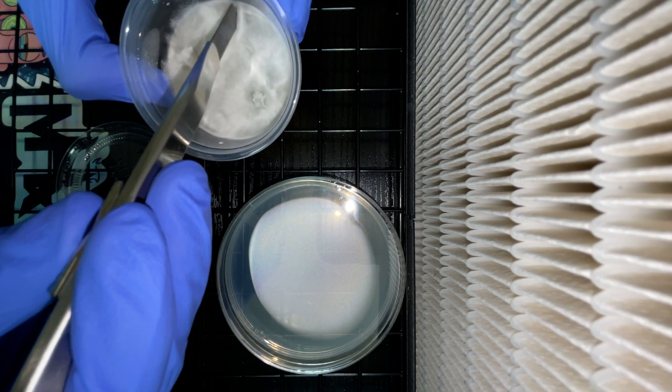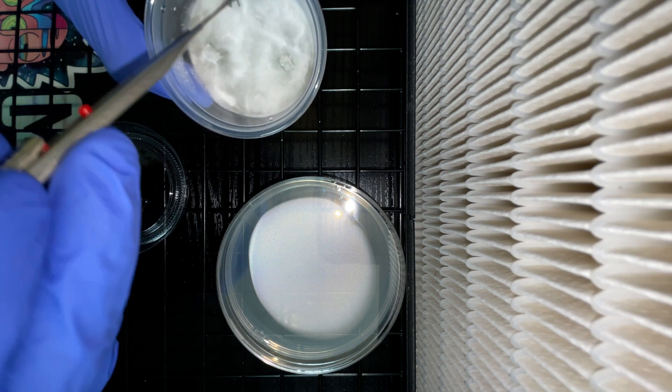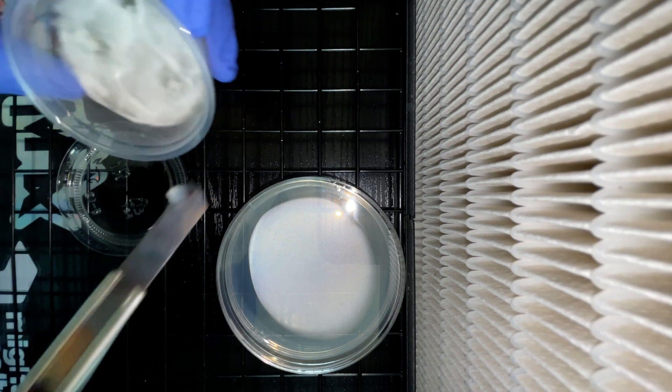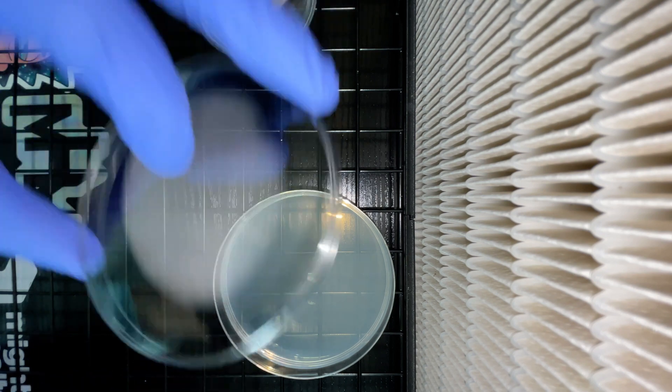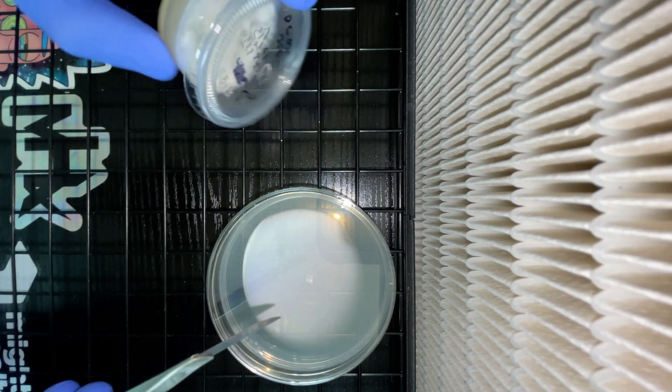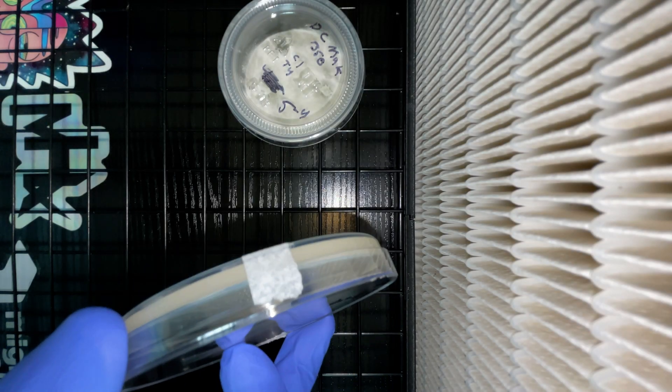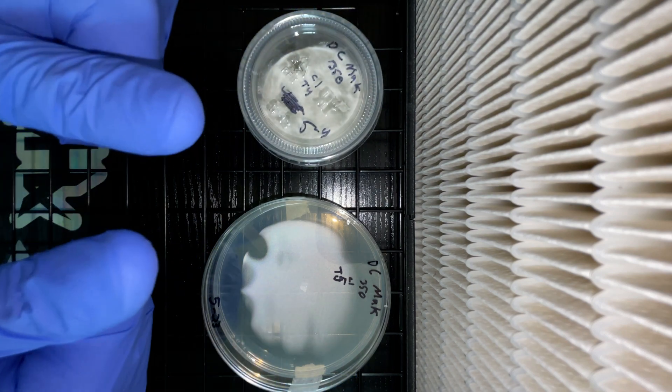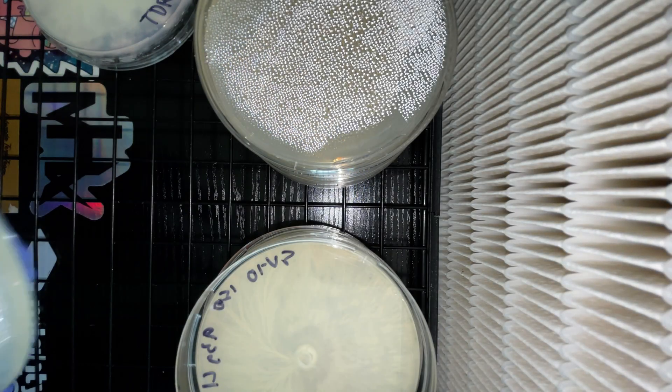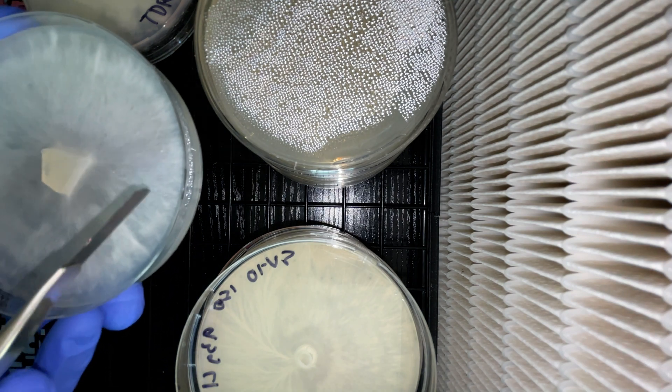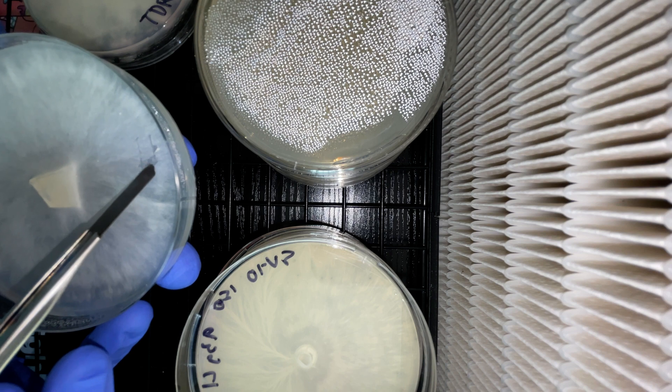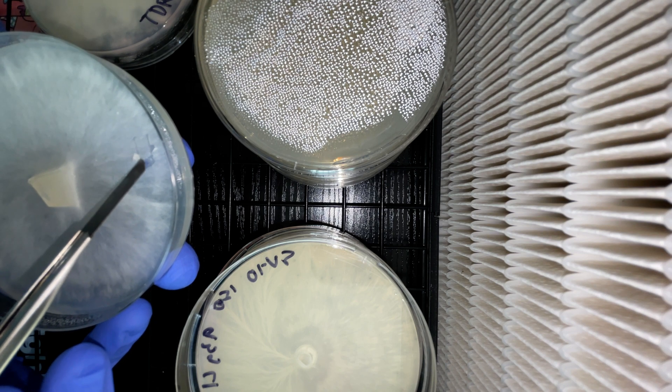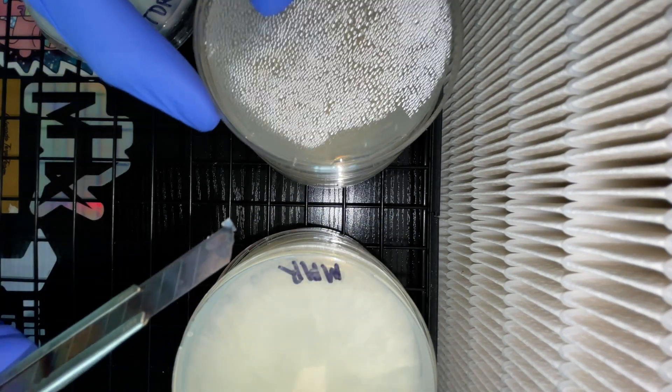This is one of those set projects that I was talking about. I actually only had one of them contaminate on me, but within one transfer I was able to clear it up and it's looking perfect now. I believe I received 16 cultures and all of them are looking perfect. These are actually some of the original plates that I had received. While they're fully colonized, they had been put into cold storage for holding, so I'm attempting to bring them all back and run them. They all were actually gifted to me as this community is amazing with how giving you are.